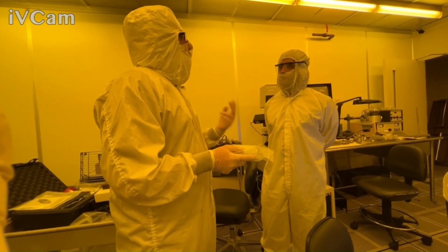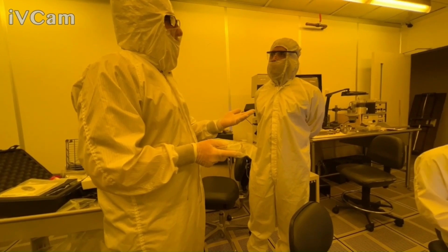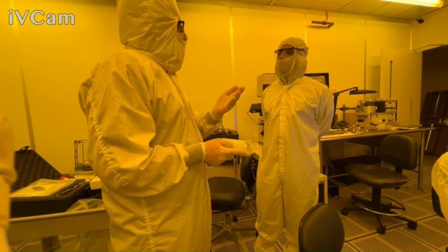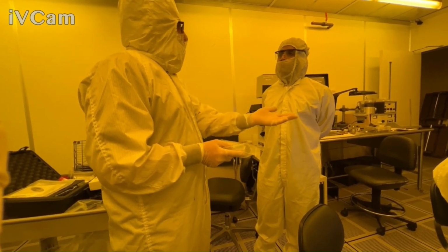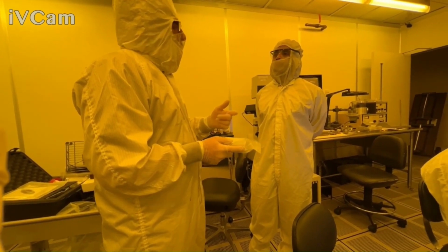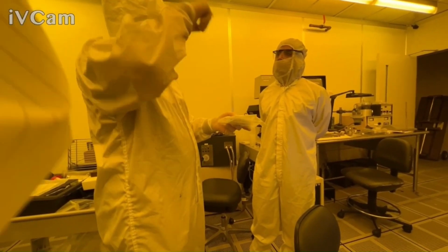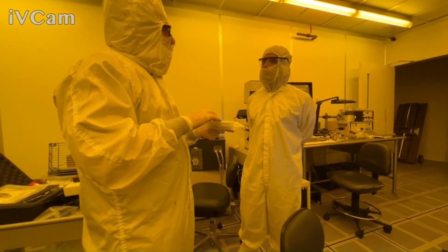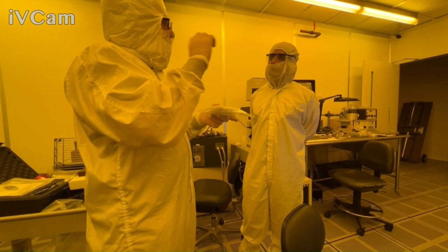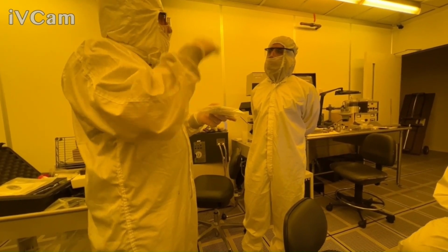So the two main tricks that people use to get around that, and I can forward a paper, is either deposit it on a quartz silica glass, so a well-behaved glass substrate, and then also measure transmission intensity and fit the ellipsometry data simultaneously with the transmission intensity. Or another trick we use is we deposit on a thick thermal oxide, because that thick thermal is going to set up that interference pattern. It's very well behaved, and if we measure multiple angles, we can basically have enough information. We call that interference enhancement or artifact minimization. Basically, we can have enough information to figure out the metal as well.